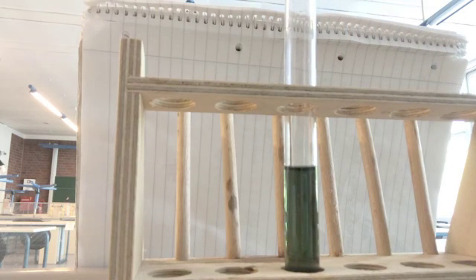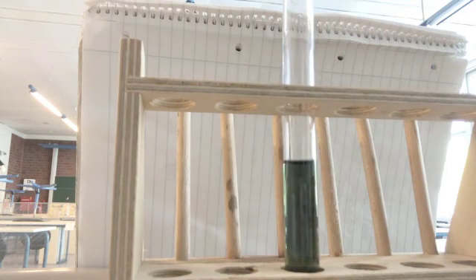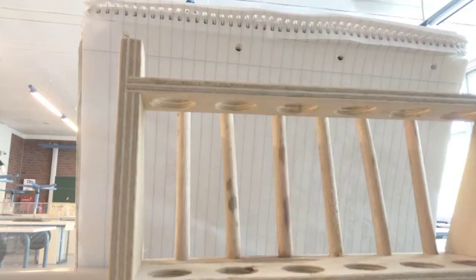It's kind of a greenish blue at this point. That's kind of our middle point. That's nice. That's kind of what I was looking for. And then if I go one more step, add a little bit more base, you'll see it turn that bluish color. So there's your acid-base reaction.